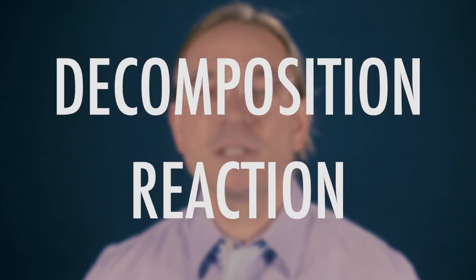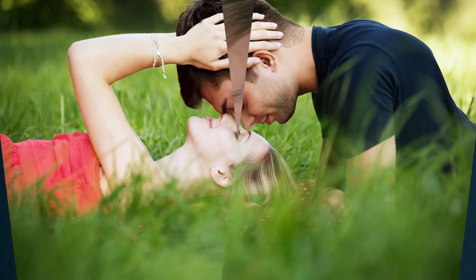The genie in a bottle experiment is a decomposition reaction. A decomposition reaction occurs when one reactant breaks down into two or more products. In its most basic terms, if I have compound AB, the reaction breaks it down into A and B. Not ABC, not AB plus C, not BD plus F. We had AB and now we have A and we have B. Like your couple friends who broke up last month — they're still there, they're just not together anymore.